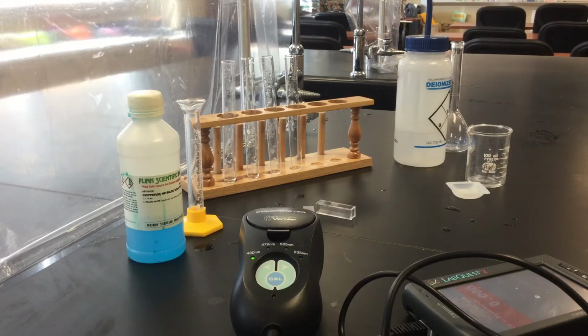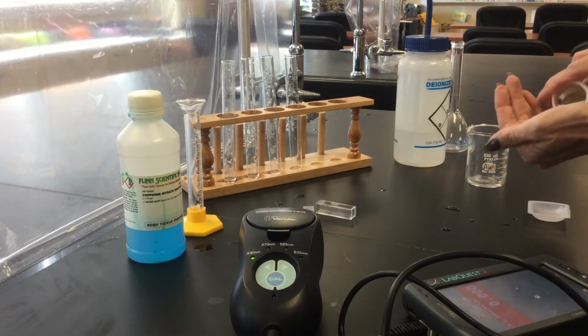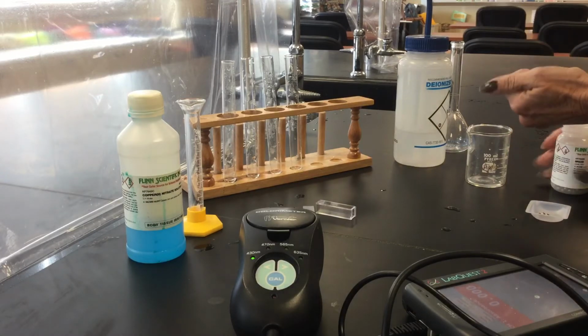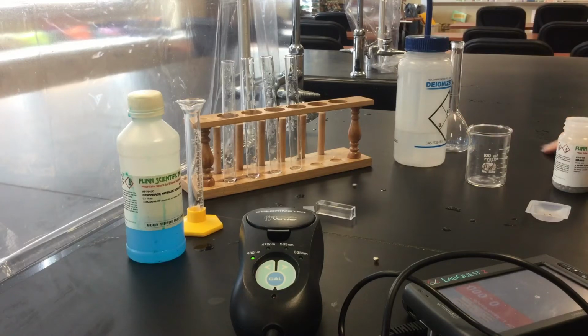Maybe if I can open it. Let me try a different container. Okay, so I'm just going to add, was it 3 BBs? Three BBs, and I'm going to go weigh them. Oh no, I've got BBs everywhere. Oops. Oh, I lost one. Got the other ones though.